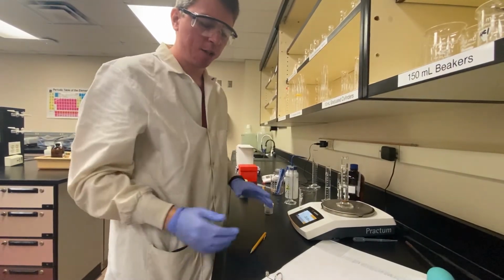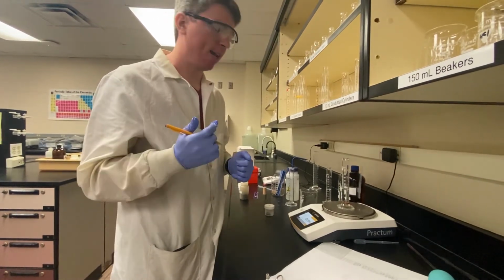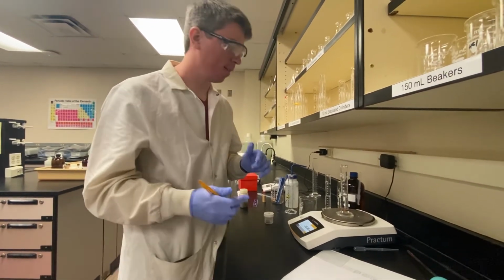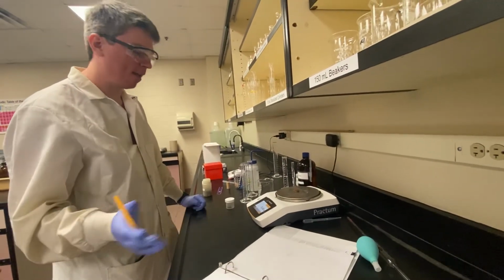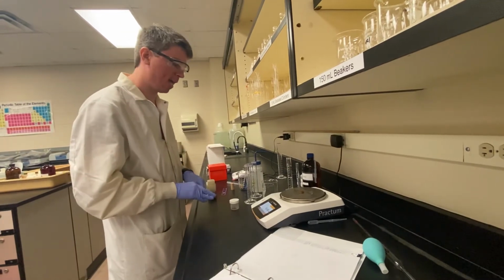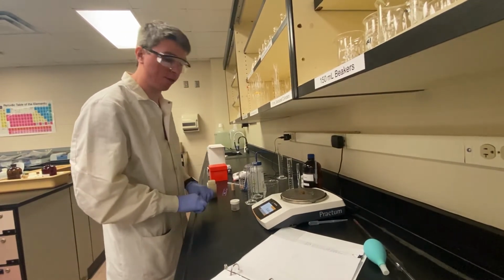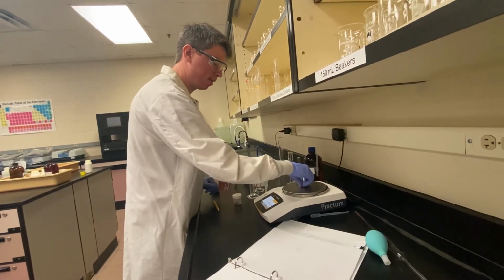So we have our initial volume, our final volume. We'll get the change in volume, and that is the volume of the pennies that we'll use for the density. And again, we can get the mass per penny and the density of each penny from calculations that we'll do at the end. And then I'll go ahead and do the other decades of pennies to provide data.